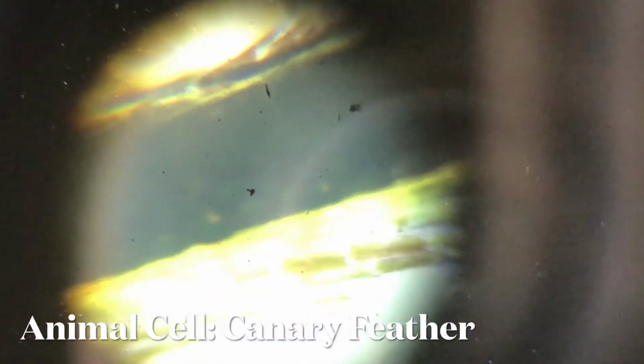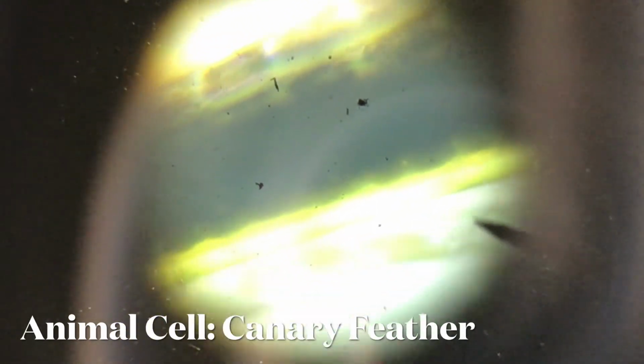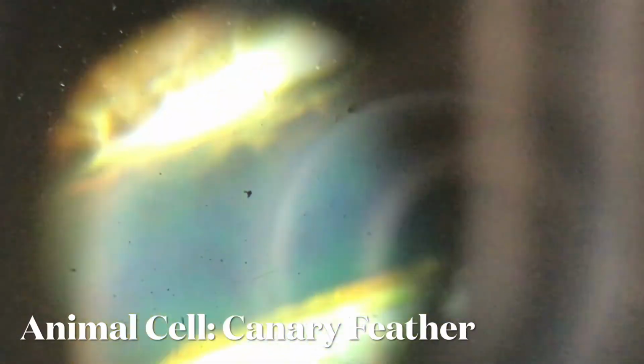The next thing we are going to see here is an animal part that comes from a canary, and that is the feather. You can see that when we look at it under the microscope, the canary's feather has many small fine hairs that actually make it what it is. Just focus again to help you see the parts.